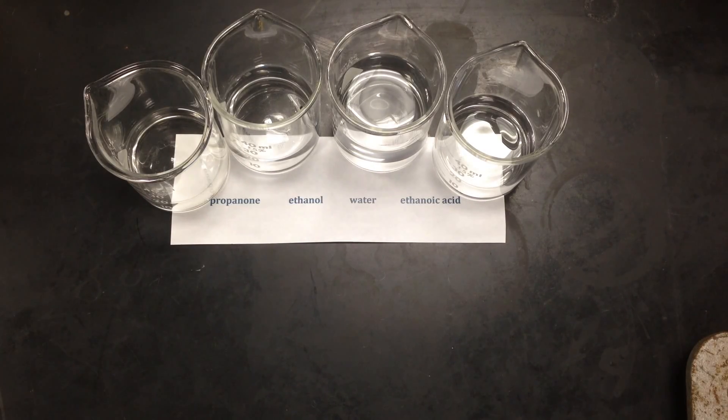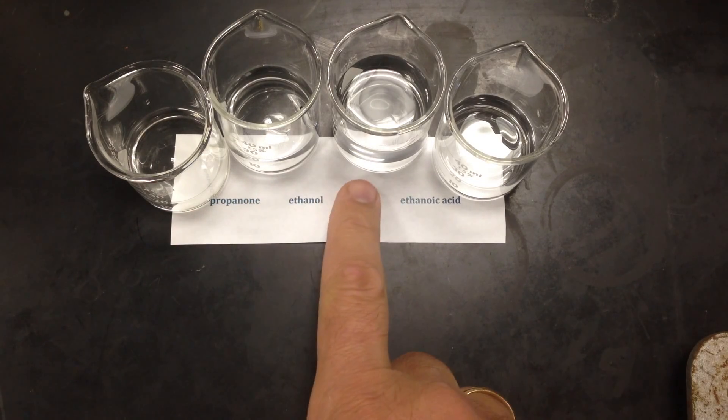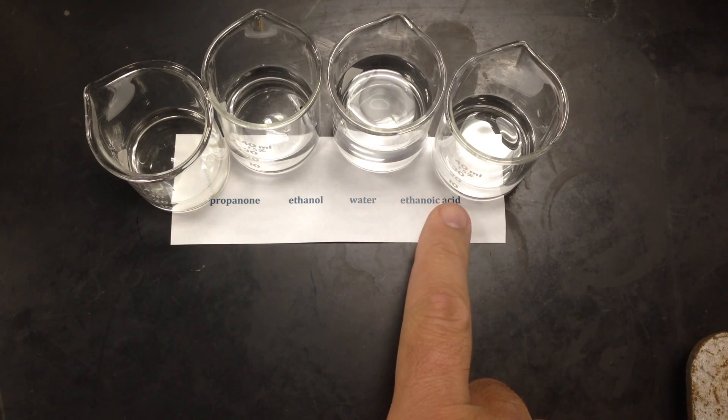This is a demonstration of vapor pressure. I have four liquids: propanone, ethanol, water, and ethanoic acid.